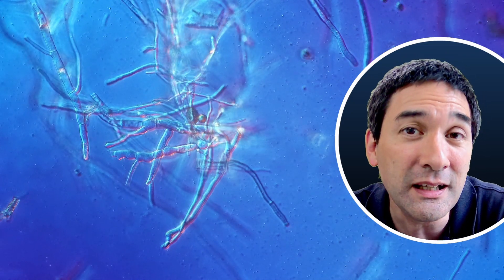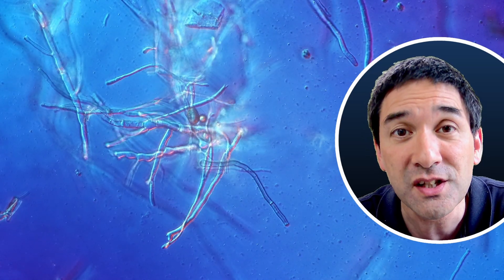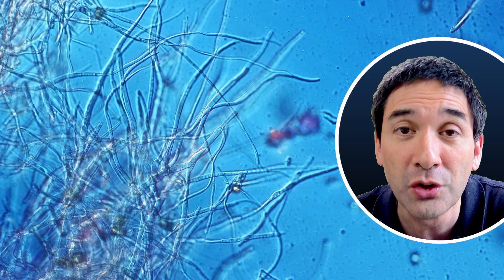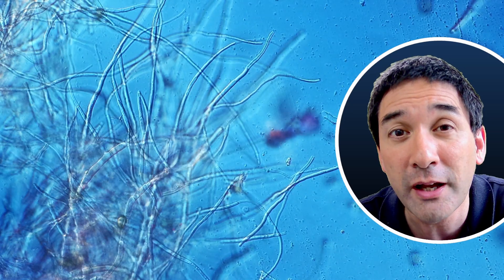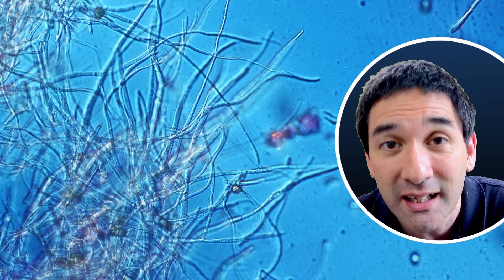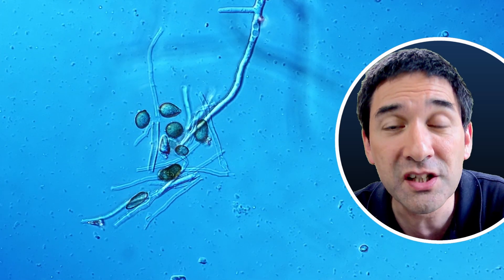Now the thing I also found are bacteria — how are bacteria different from the fungus we have here? Well, there are several important differences. First of all, the size of the cells is quite different: fungi are significantly larger. Some bacteria can grow in filaments, however fungi are also branched, and most bacteria that grow in filaments are not branched — so that's one important criterion to distinguish fungi from bacteria besides size.